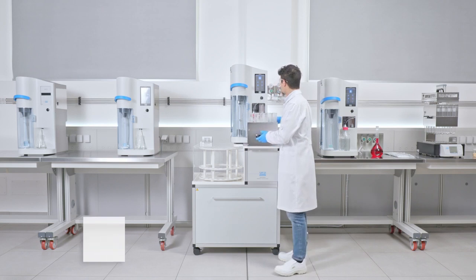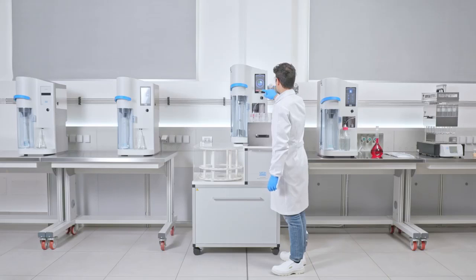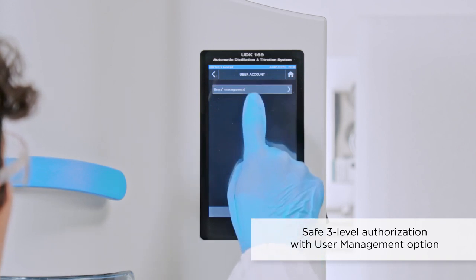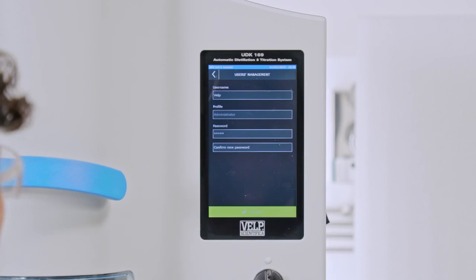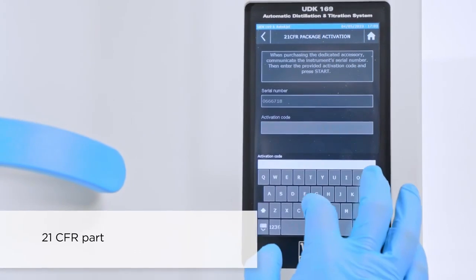Thanks to the intuitive user interface and the bright 7-inch touchscreen, the operator can easily control each step of the analysis and access results seamlessly. The user management option ensures security and compliance, granting access with 3 levels of authorization. Furthermore, the optional 21 CFR Part 11 upgrades the software for FDA compliance.